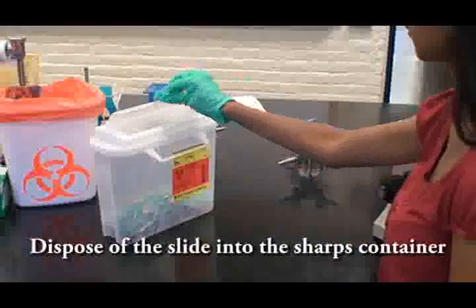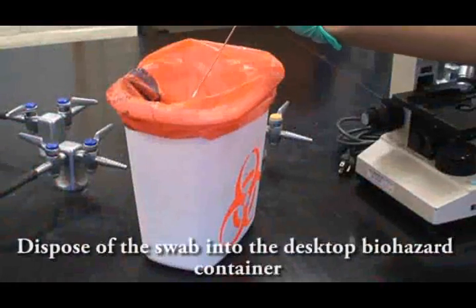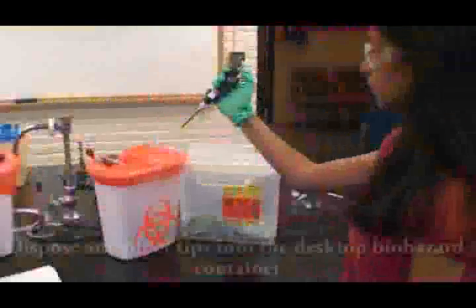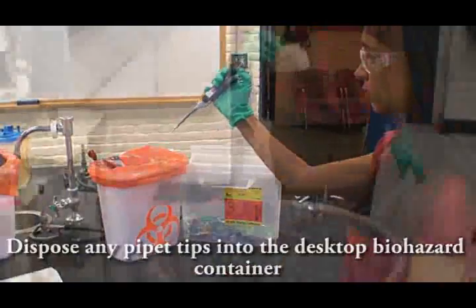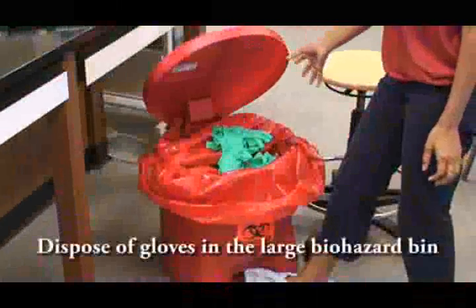Dispose of the slide in the sharps container. The swab and any pipette tips can go in the biohazard bin on the counter. The paper towels can go in the trash and the gloves need to go in a biohazard bin.